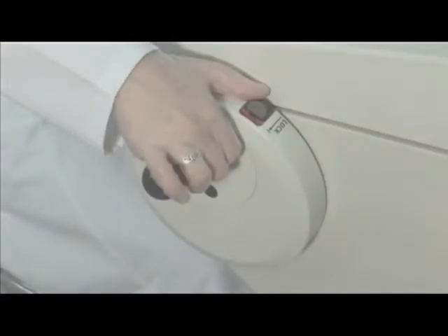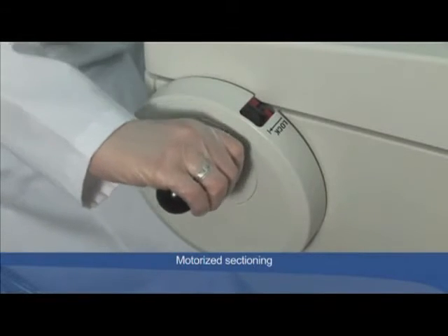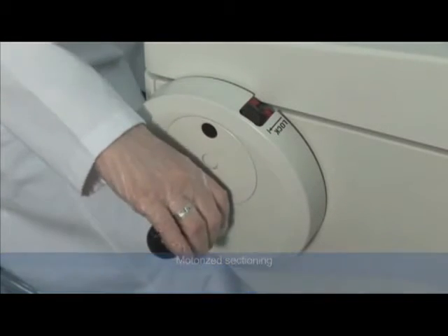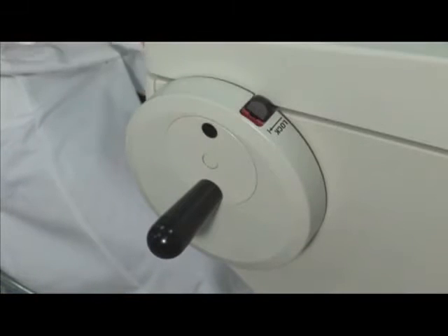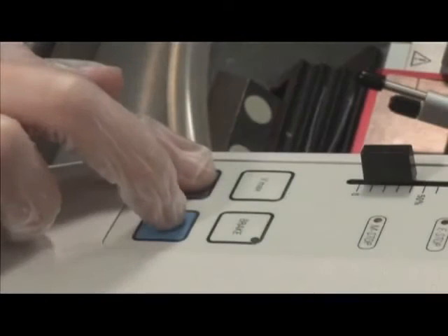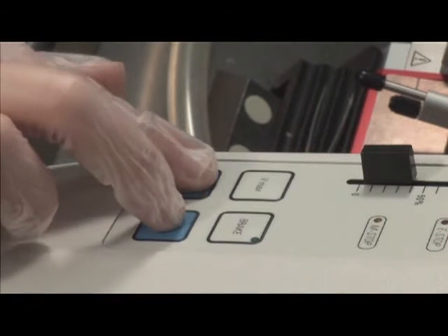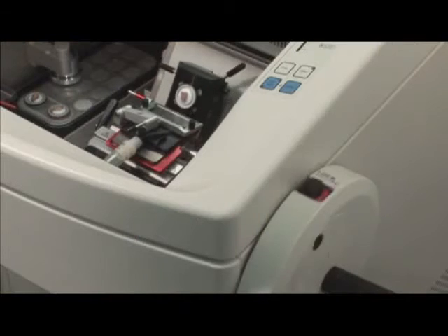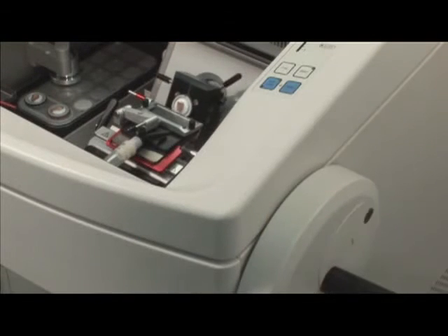The motorized sectioning mode protects the user against repetitive strain injury. The handwheel can be centered before the motor starts. For safety reasons, motorized sectioning only starts if the two start buttons are pressed simultaneously or the foot switch is operated.